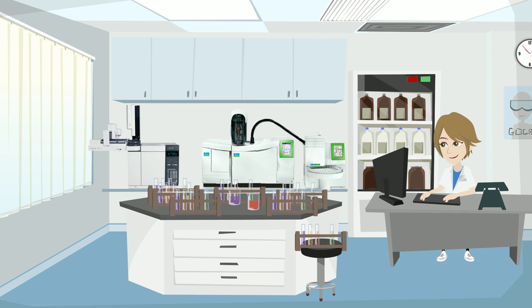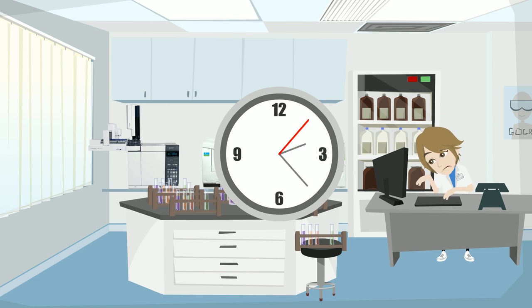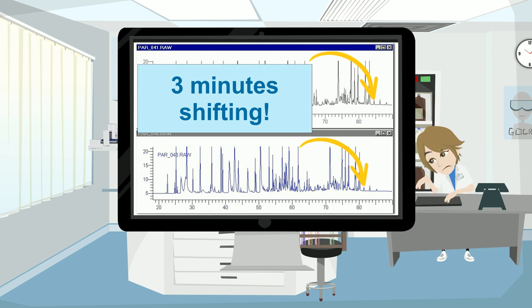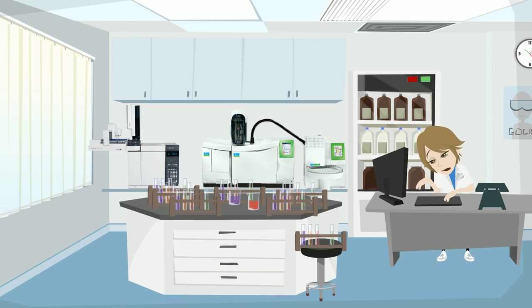Because of the chromatographic technology, the only way Sarah could compare these chromatograms was manually with her eyes, and it takes a lot of time. Indeed, in chromatography, the retention times are moving randomly, so the peaks are not aligned with the chromatogram reference. It's a tedious work, and sometimes she made mistakes.